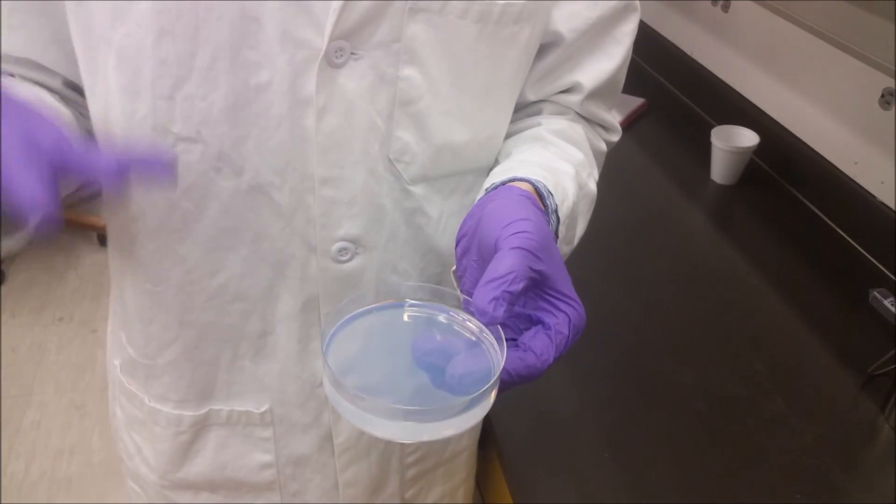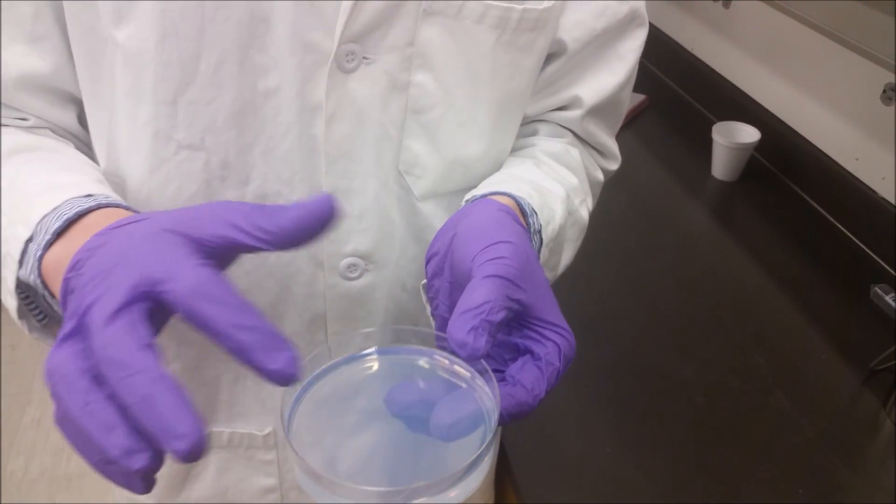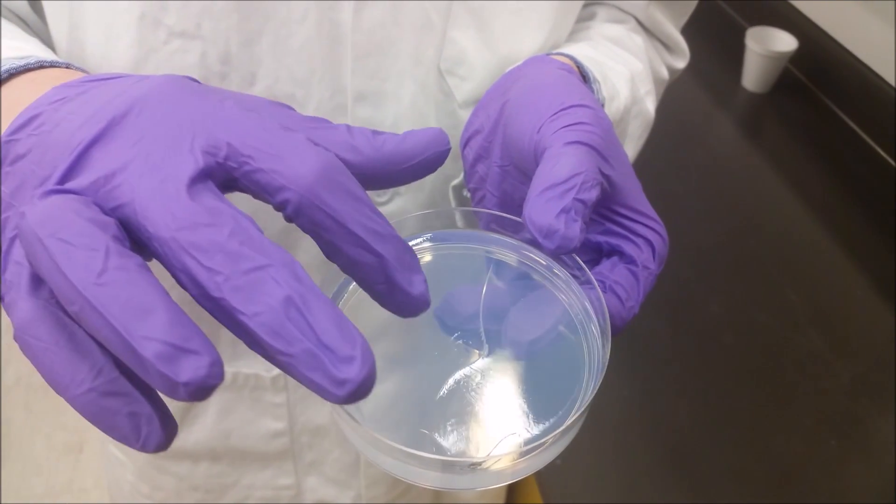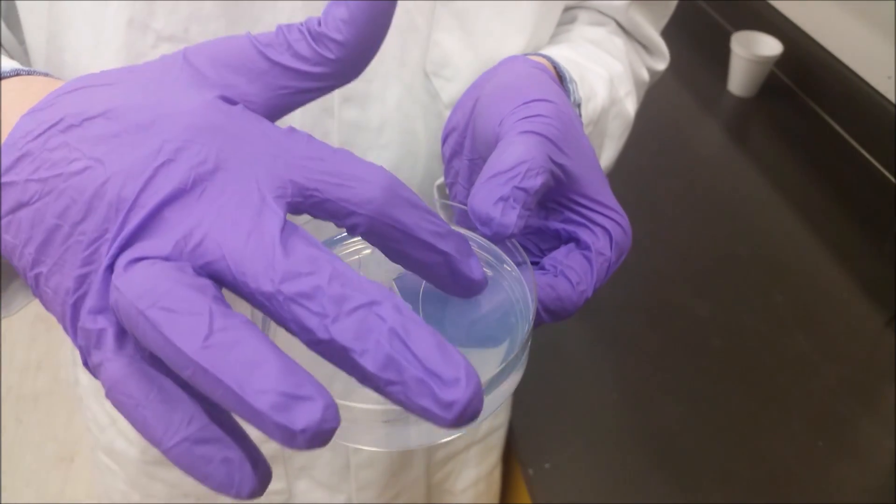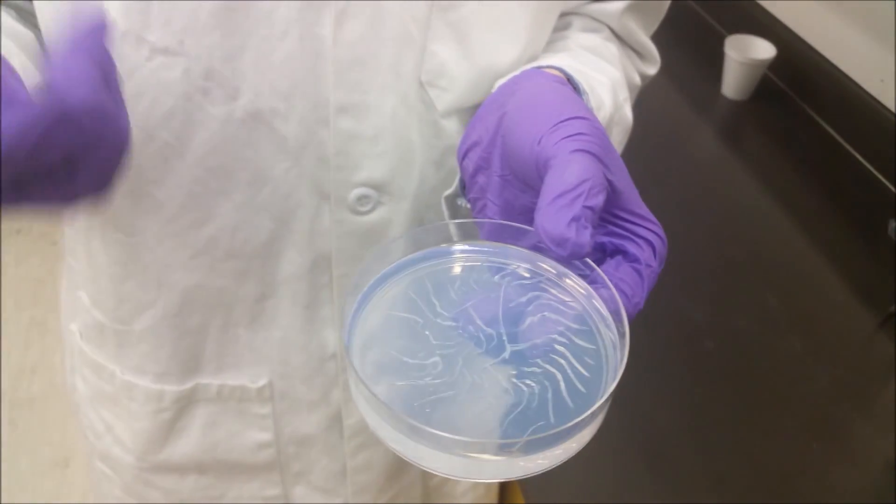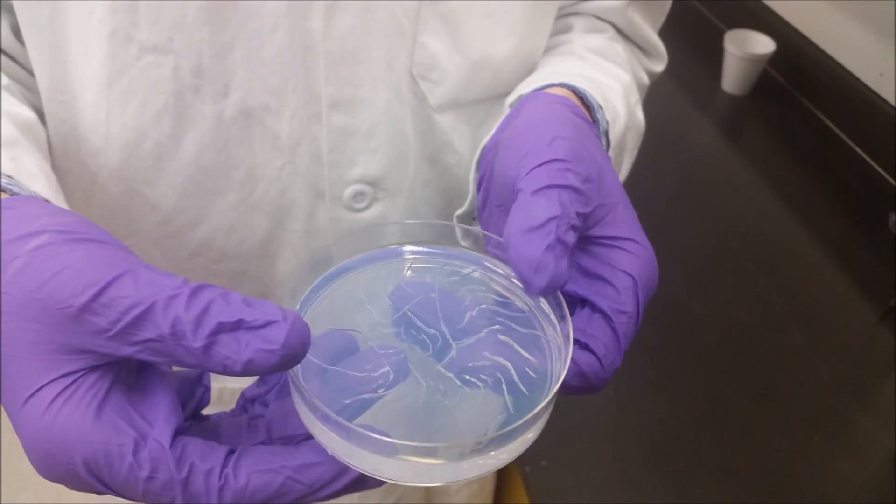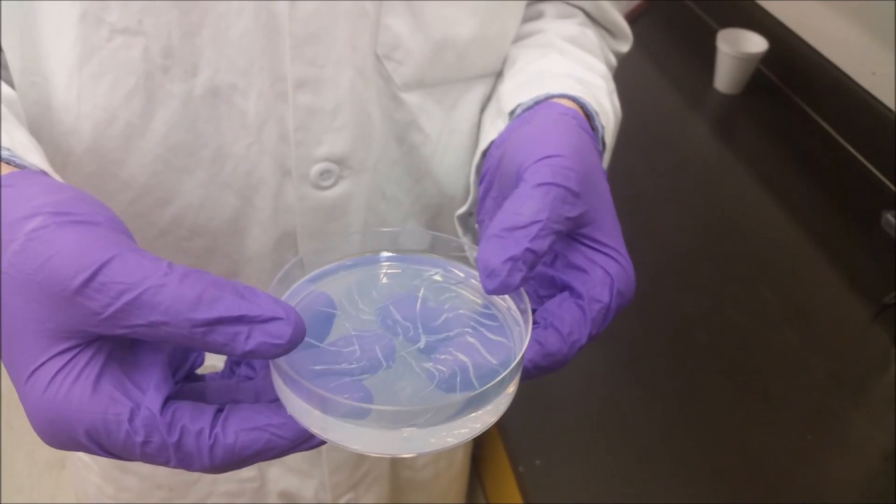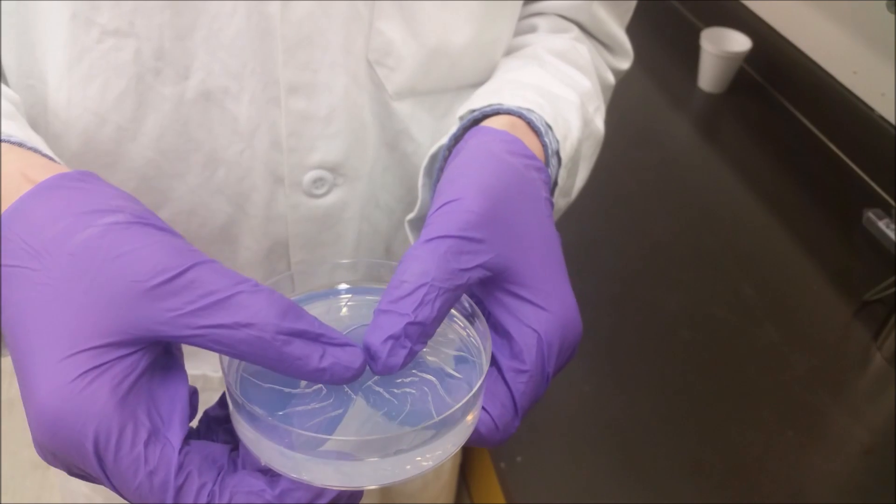The different thing about this is it's not squishy like a jello or some other kind of gel, something that you might associate with that word. In fact, it's very brittle. You can see touching it produces a crack. So that's a very important distinction with sol-gels versus some other kinds of gels. Although they are from the same root word, what ends up happening is they are very brittle.